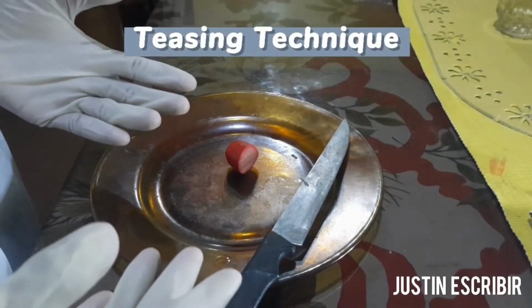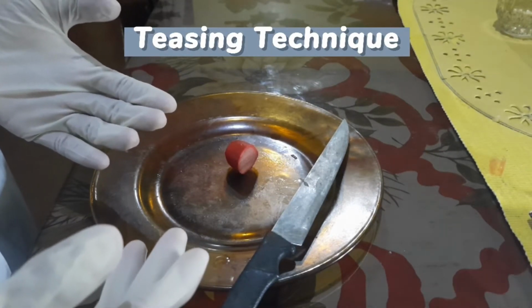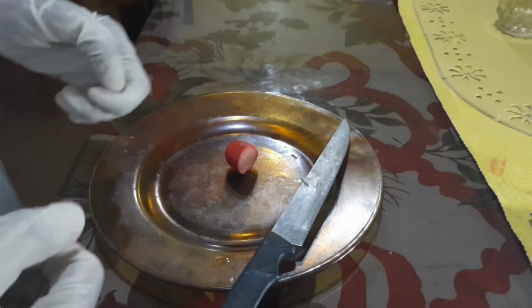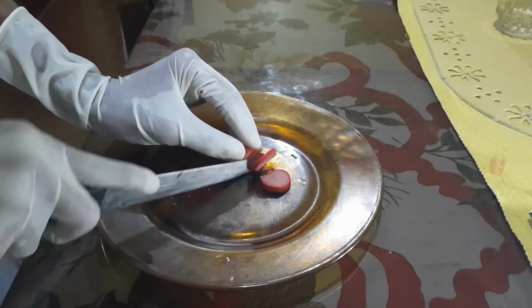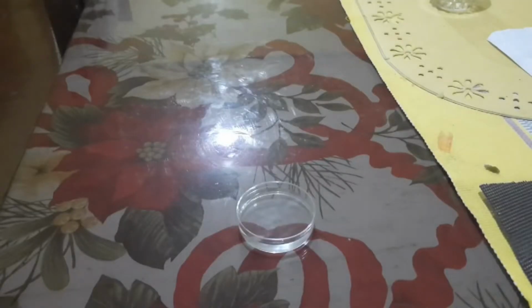One of the many steps in preparing the tissue specimen is the teasing technique. So from our frozen block of tissue, we cut several small thin slices. After cutting it into thin slices, we then immerse the tissue specimen in the petri dish containing the saline solution.